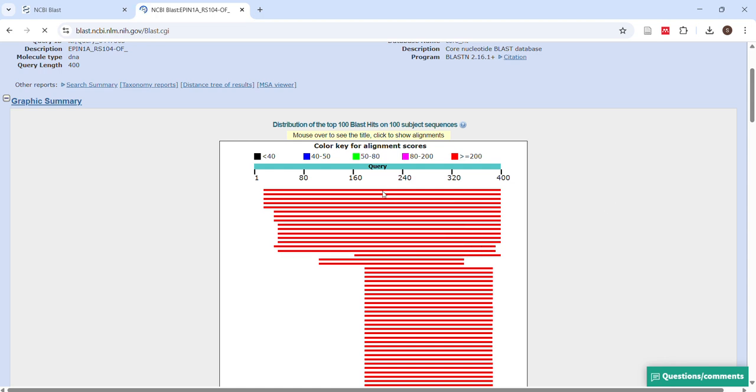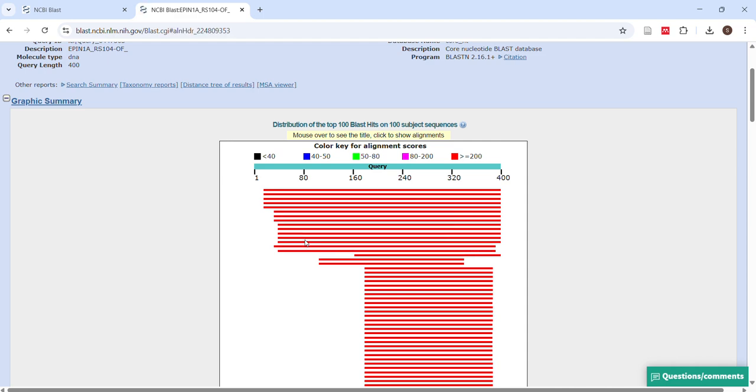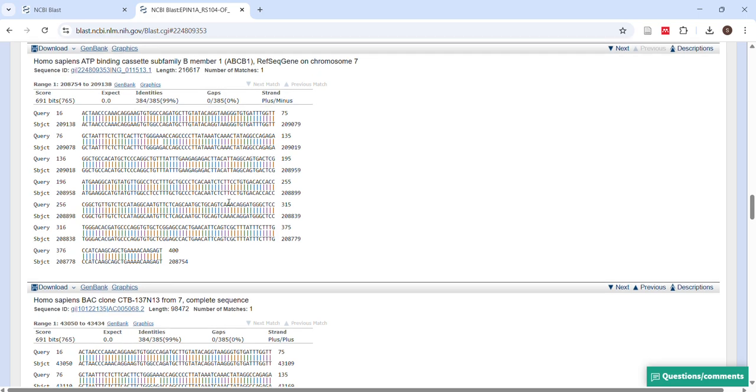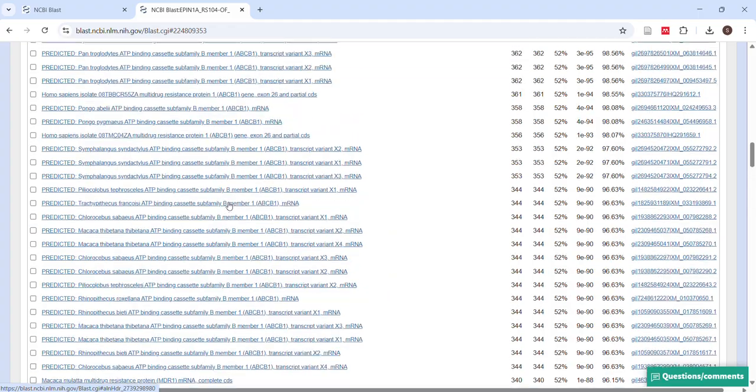So if I just click here again and I check for the alignment, it will show me the accession number and all. It will bring me here, right? So if I see here, it is showing me the query, that is what data I have given, and the subject, that is actually what is present in the database. So with this I can match it and check for my results, right?